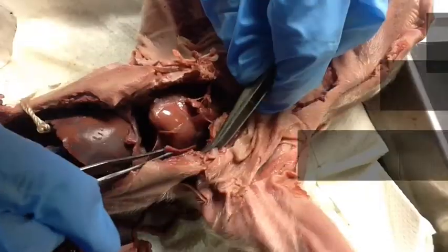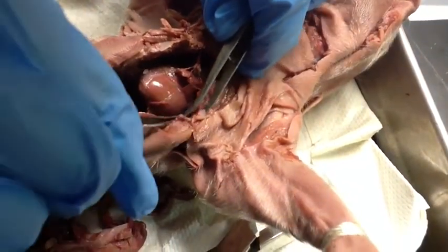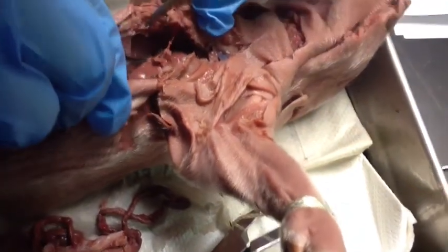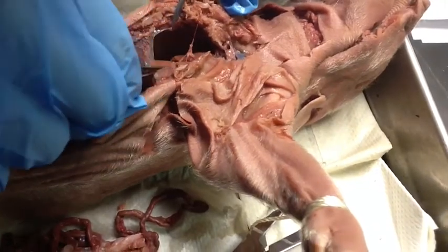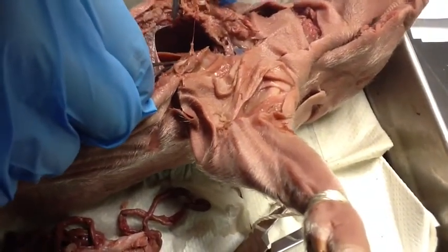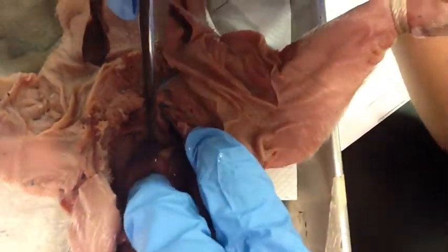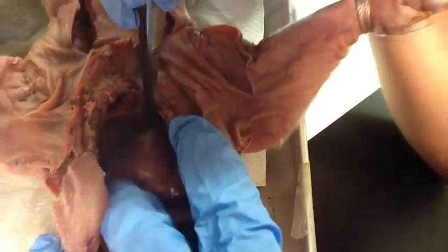Now, let's explore these systems in the fetal pig. Here we see the underdeveloped lung. It's one of the last systems to be fully developed in a fetus. Here we see the heart, a large muscle, and the second lung, which has 2 lobes and is more developed. Here at the top of the heart, you see the anterior vena cava, the blue vein, and the common carotid artery, the more pale yellowish vessel.